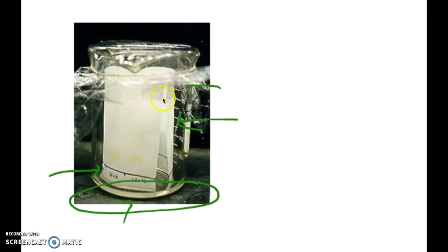And you notice here that the sample is on the outside. So you wrap it up this way, you put a tape on the top and maybe tape in the middle so that it would stay like a cylinder together in that solution. But you notice that the solvent is very low here. And then you just cover it up with parafilm. And that thing should slowly rise up. And we're going to use that time to actually do another different part of the lab. But that's going to be what the experiment is.